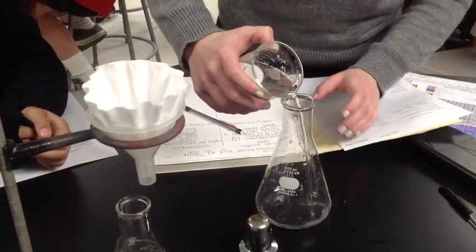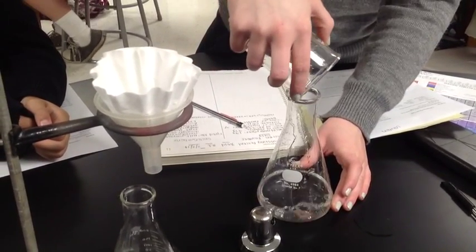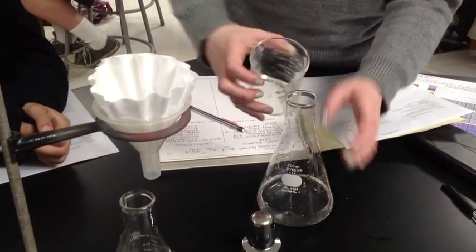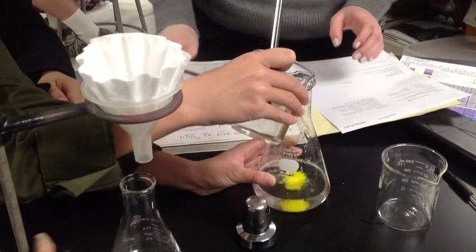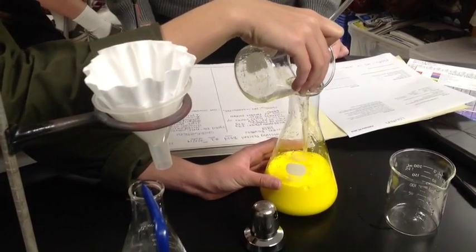Let's take a look at that again. We have potassium iodide, a clear transparent fluid, and a second clear transparent fluid of lead nitrate, but when the two mix the precipitate lead iodide forms.